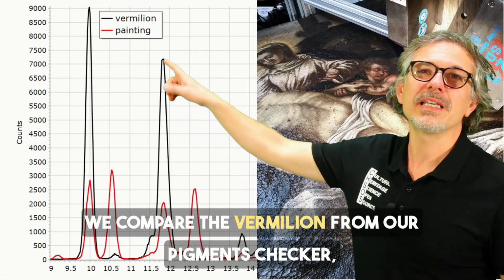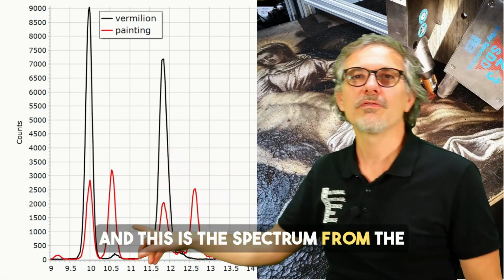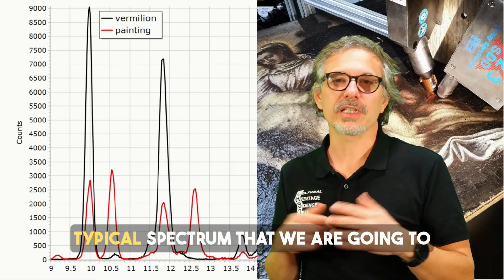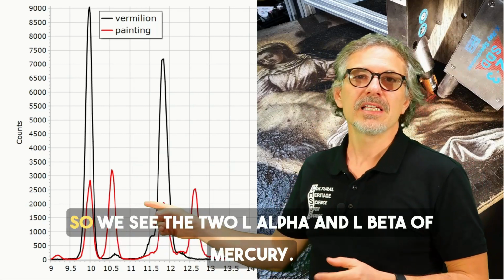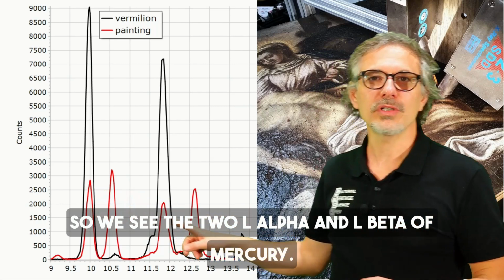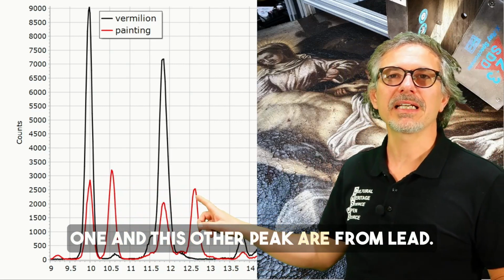We compare the vermilion from our pigment checker, so just pure vermilion, with this spectrum from the red drapery of the angel over here. This is the typical spectrum that we are going to get on this kind of painting. So we see the two, L alpha and L beta of mercury. Also we see here the L gamma, and this one and this other peak are from lead.